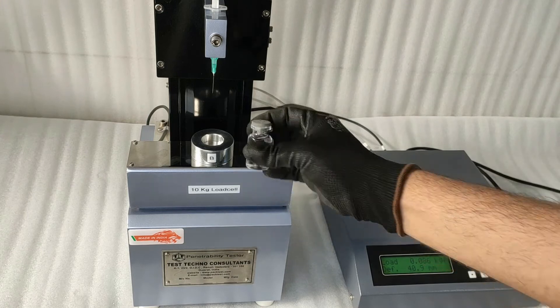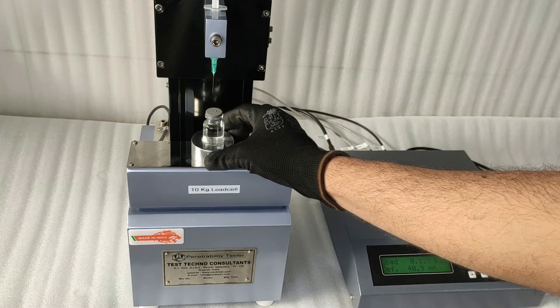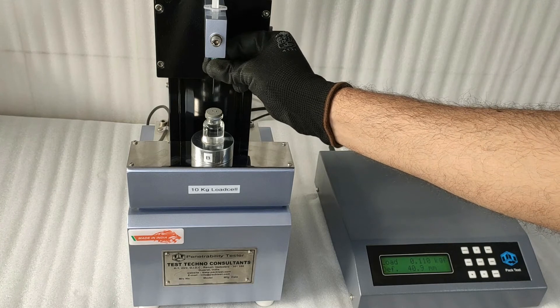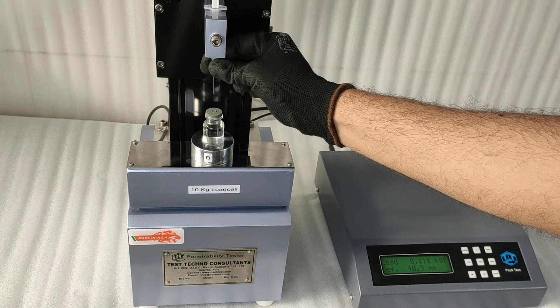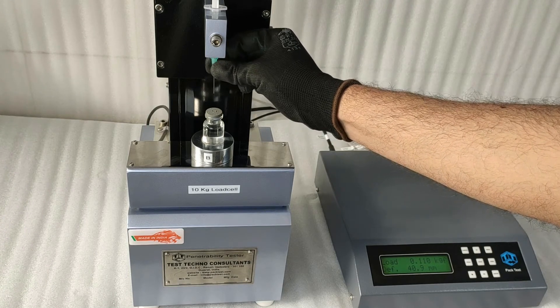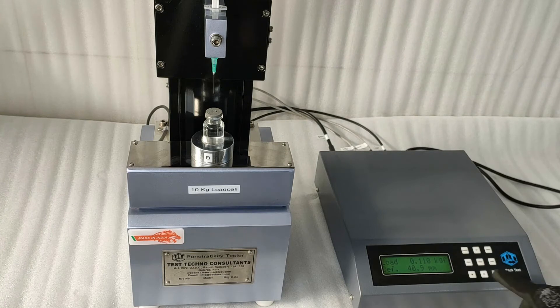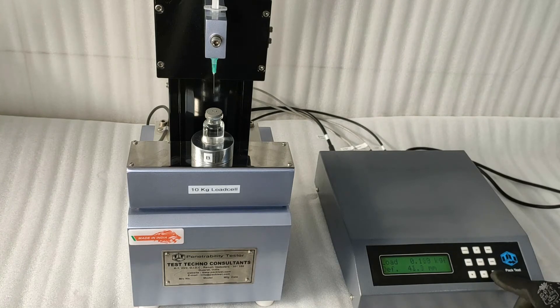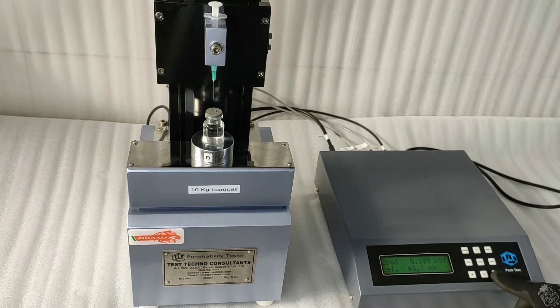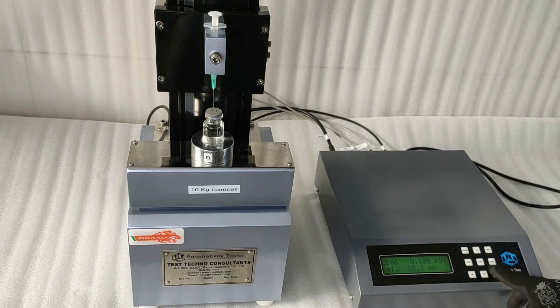Now, place the vial in the vial holder, and make sure that the needle is centered. Using the up and down keys, place the needle about a centimeter above the sample.